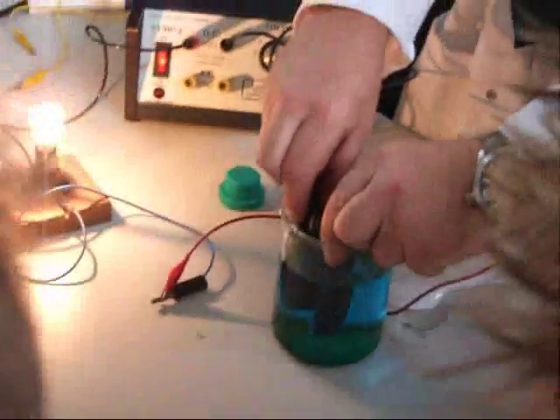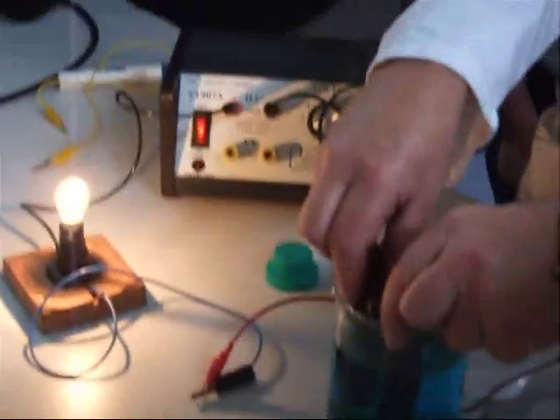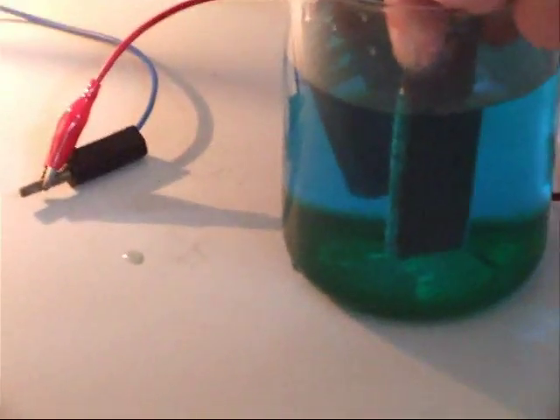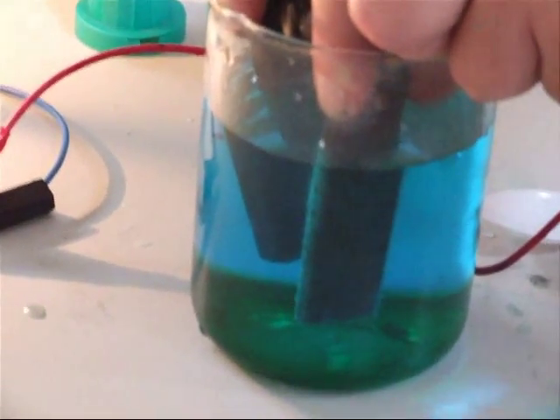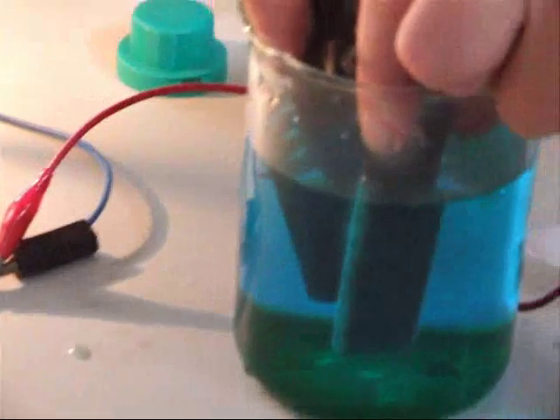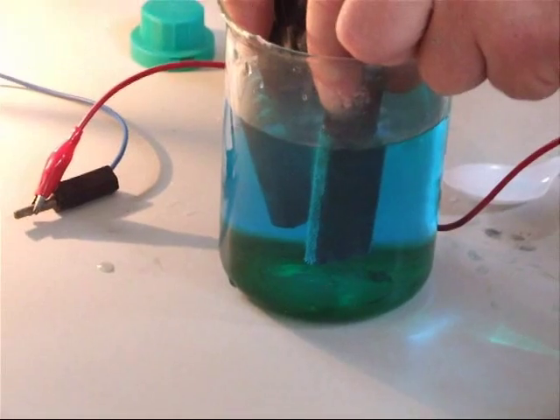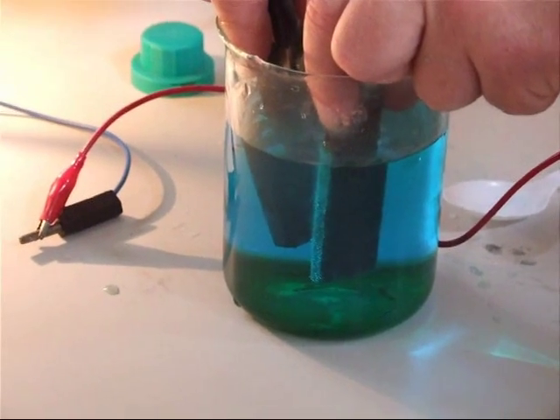Let's have a look at what happens to the electrodes once we let that solution run. One of the electrodes is bubbling. Which electrode is that connected to? The positive one. The chloride ion was going to go to the positive electrode. So the chloride ions at that positive electrode are being turned into a gas. There is chlorine being given off here. The positive electrode has enough electrical energy to pull the electron off the chloride ion and turn it into a chlorine atom.